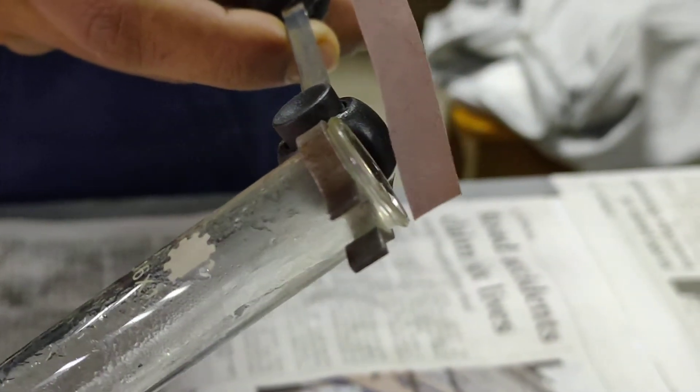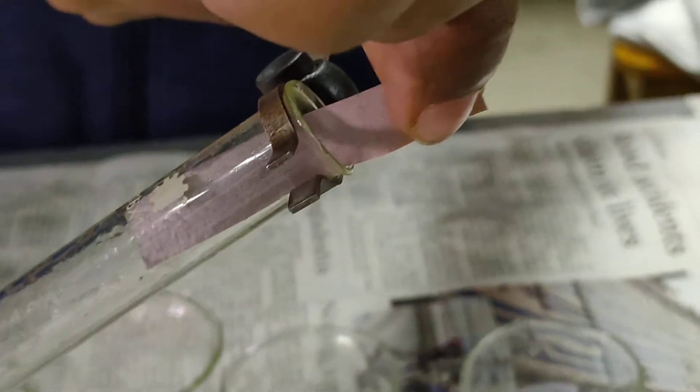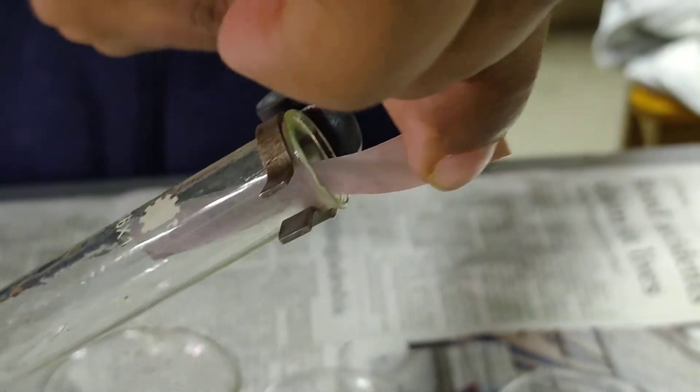The red litmus paper has become blue in color. The red litmus paper is becoming from red into blue, it is blue.